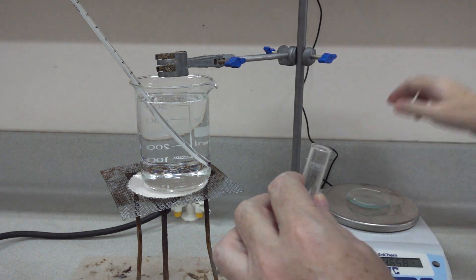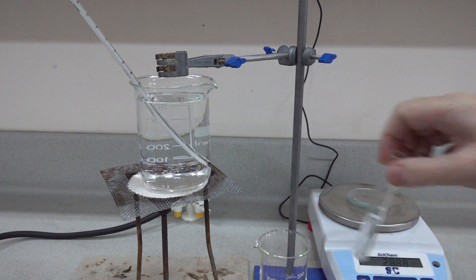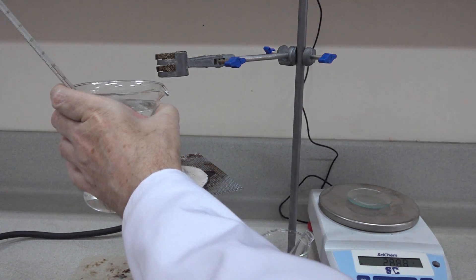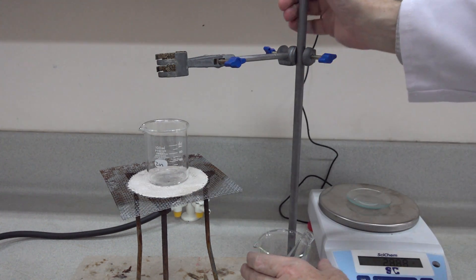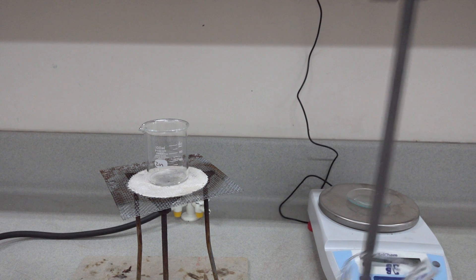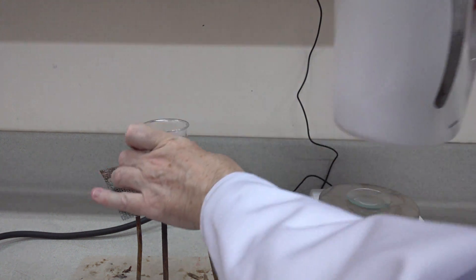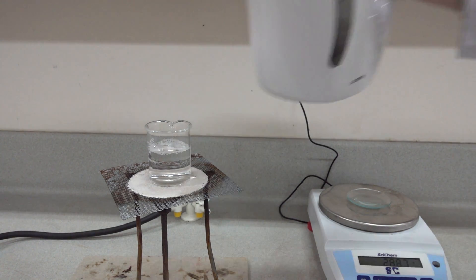That's quite a splodge. We'll re-weigh — it's now weighing 28.88 grams. We've now finished with the water bath here and we can remove it. And what we need is a boiling water bath, which we'll make in a small beaker here. We no longer need the clamp and stand, but we do need some more boiling water — in that goes, two thirds full.